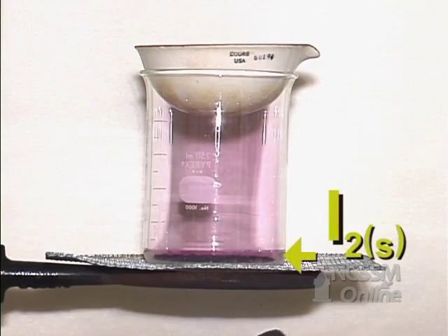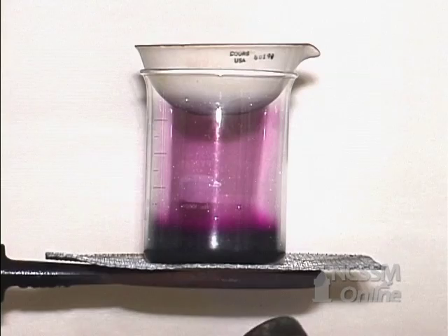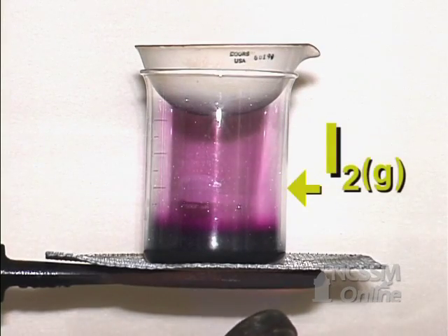In the beaker we have some solid iodine. We'll heat the iodine. The iodine will sublime and go directly from the solid to the vapor.